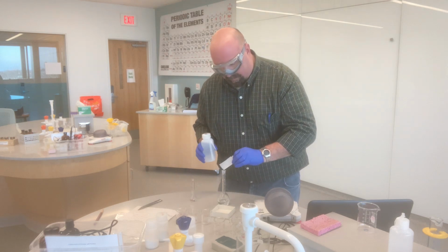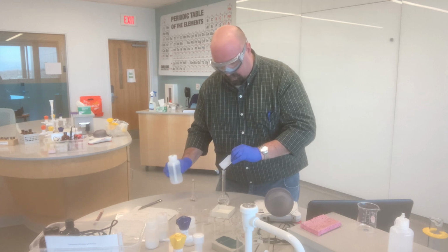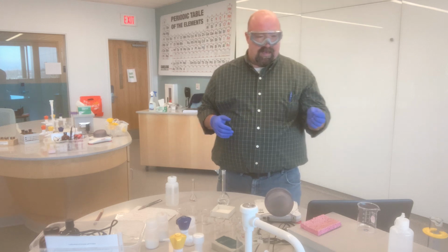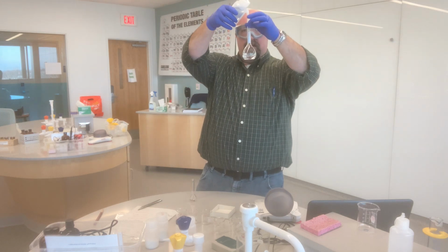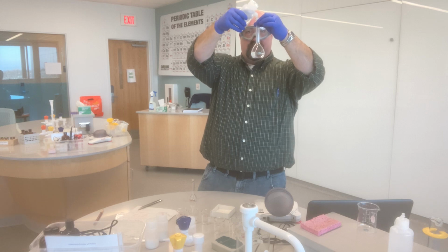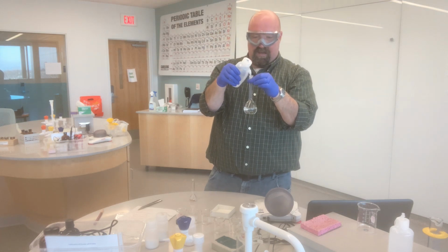You can't see it, but there's a little bit of solid left in the crease here. And so I'm just taking my water bottle and squirting that down in, keeping the crease so everything flows down into the flask. So now I have my solid in here as well. So I'm going to just now fill up to the line. I'm going to use the water bottle to just squirt down the sides, make sure that any solid that might be sticking to the sides of the flask is actually rinsing down in.